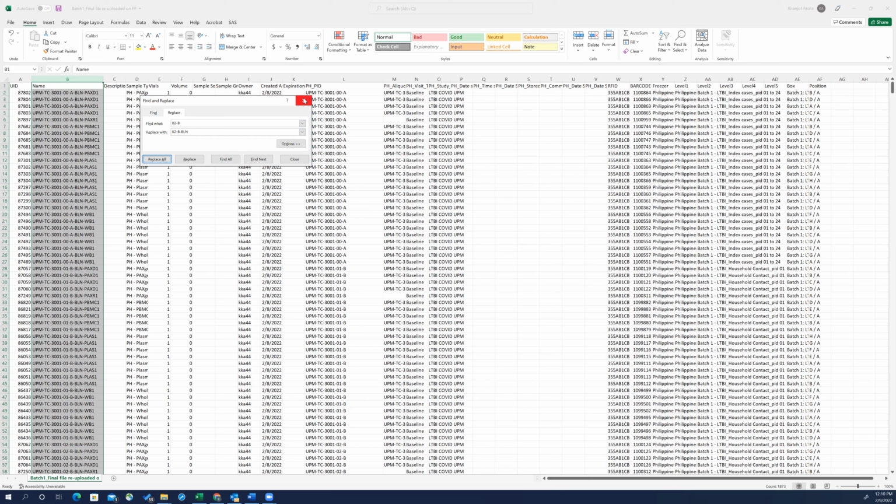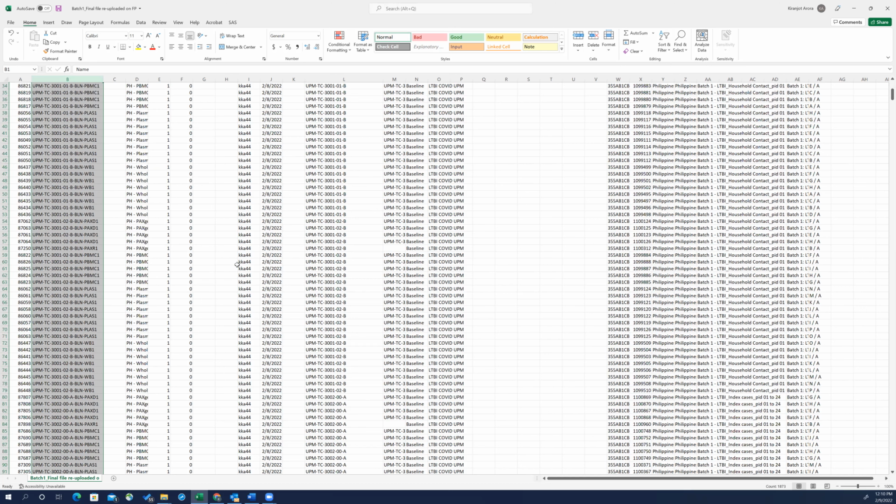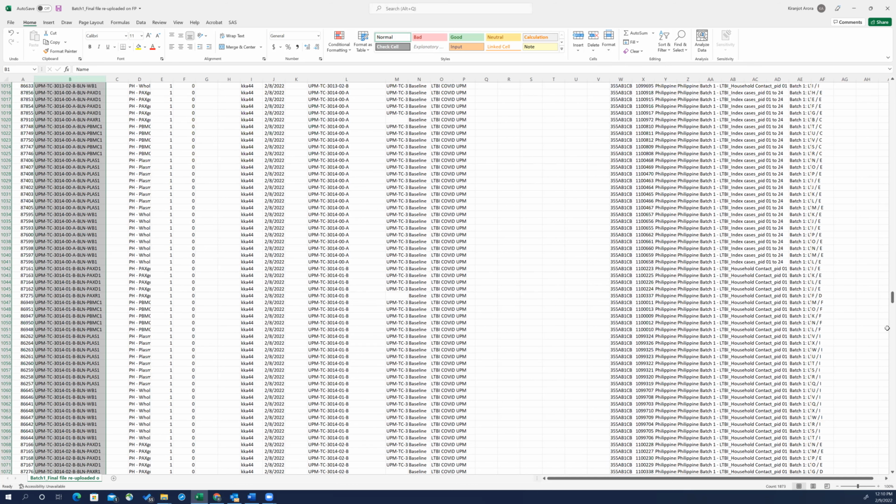624. So that's all of the variables are now changed, and the sample names will now have a BLN in the middle. I'm just going to have a quick look to see if there is any place where there isn't. So the idea is to find a key variable that you can use the find and replace function on to make the bulk change.